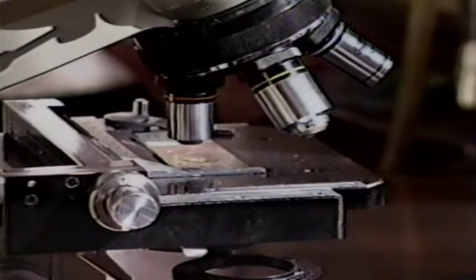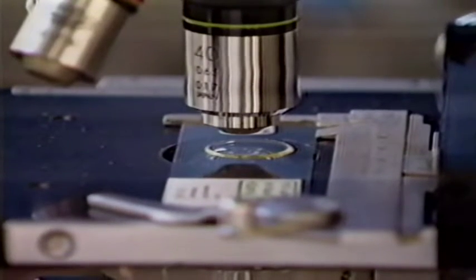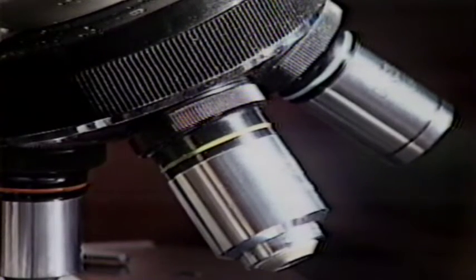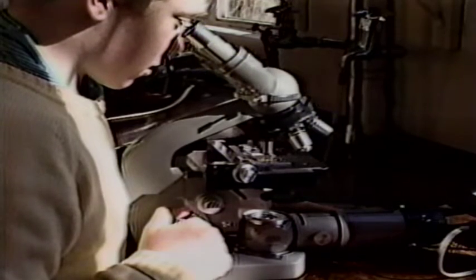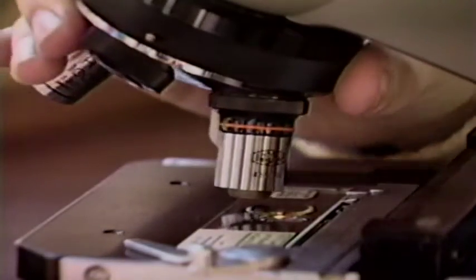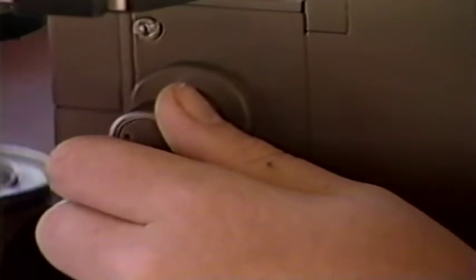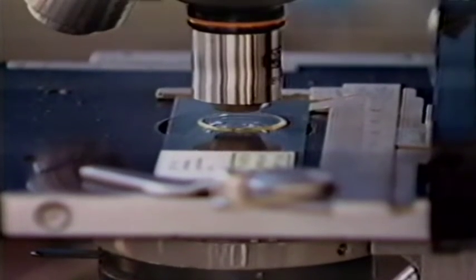When working with a compound microscope, you should always start with the lowest magnification, which is the shortest lens. The exact magnification is listed on the side of the lens mounted in the nosepiece. Once the objective lens is clicked into place, focusing begins. A coarse focus can be obtained by rotating the large knob until the image sharpens. After you have finished examining a specimen at the lowest magnification, you may wish to use a higher magnification. At the highest magnification, only the fine adjustment knob should be used in order to avoid destroying the slide by pushing the objective lens through it.